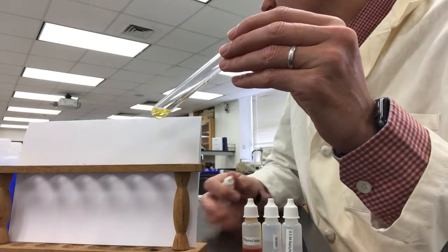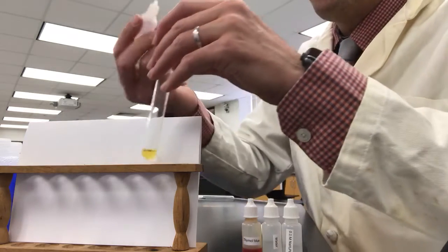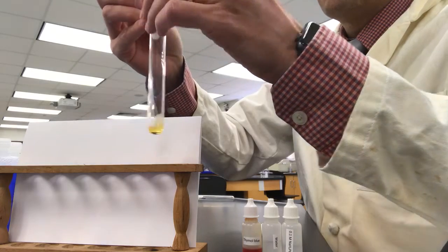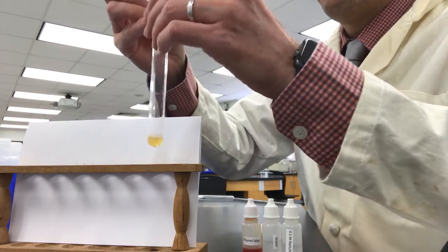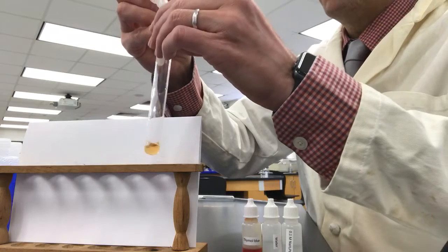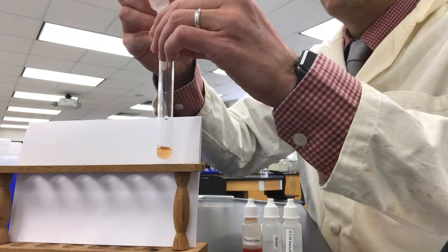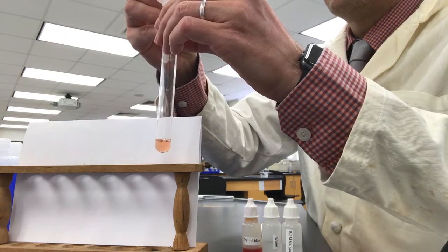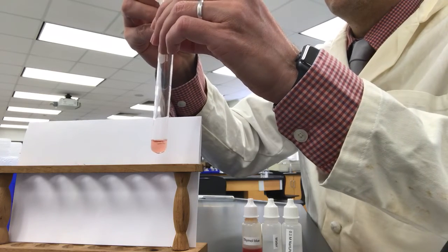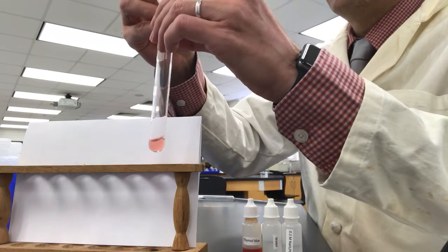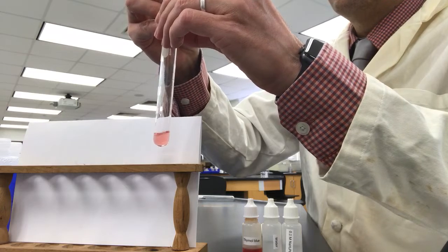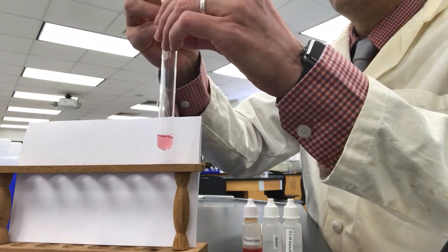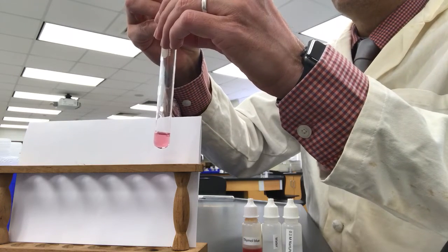Now we're going to add hydrochloric acid to this drop-wise. That's one drop, two, three, four, five, six, seven, eight, nine, ten, eleven, twelve, thirteen, fourteen, fifteen, sixteen, seventeen, eighteen, nineteen, twenty.